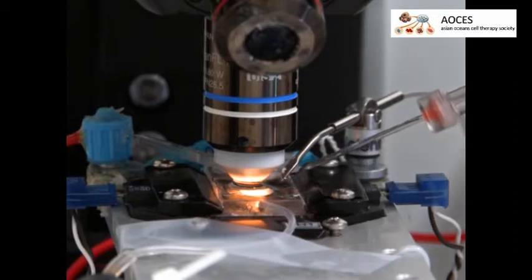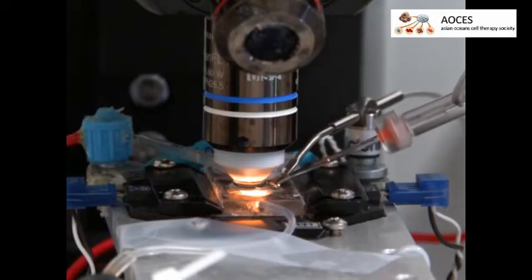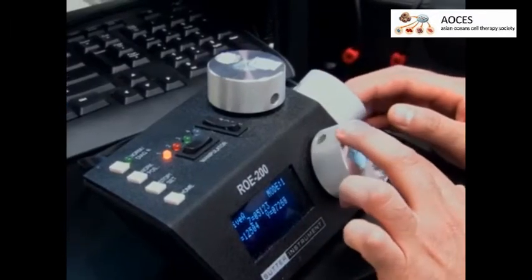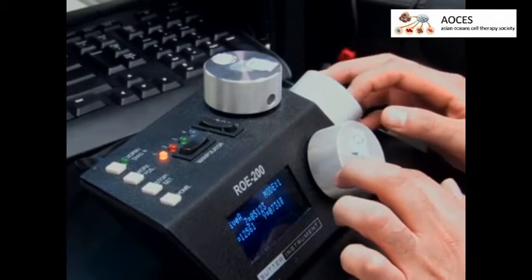Using the micromanipulator, guide the pipette down to the chamber so it is roughly under the center of the immersed objective. While moving the micropipette with the micromanipulator at medium to high speed, locate the micropipette on the computer screen and guide the micropipette toward the location of the cell on the xy-axis.